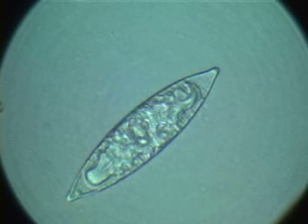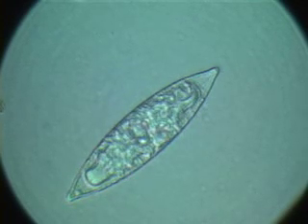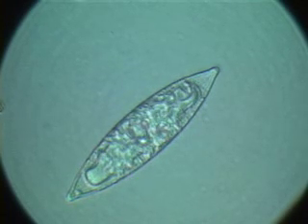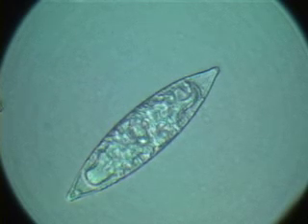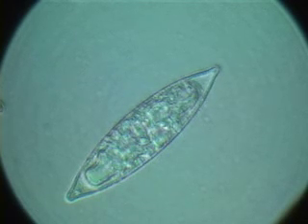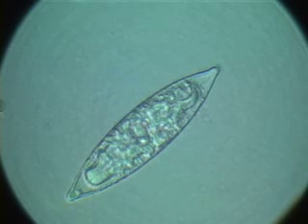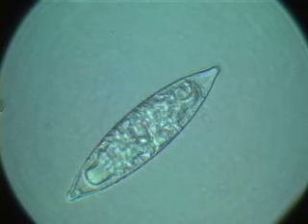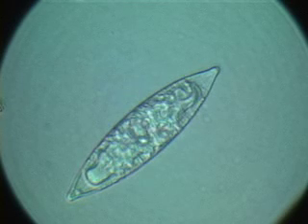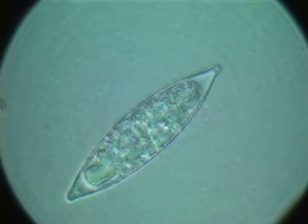A taxonomist would look at the size of the cell — this cell is about 80 micrometers long. They would measure the length and the width, look at the details of the frustule: how many pores there are in the center, how many pores there are to the sides. Based on that they would use a taxonomic key and identify the species.